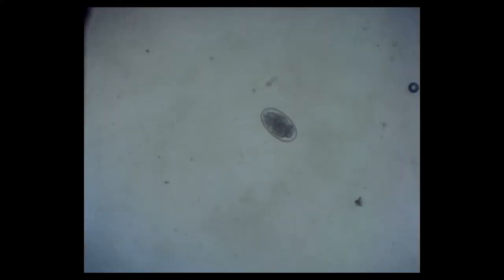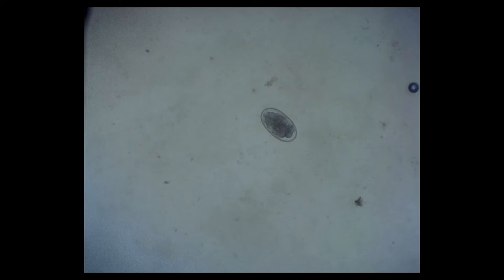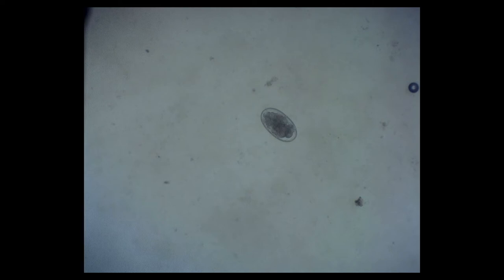What you're seeing now is a good scope cam picture of a strongyle egg. Whether this is Haemonchus, Ostertagia, or trichostrongyle — which are together known as the HOT group — is really hard to distinguish under 100 power magnification. So we just count them all the same, and that's our fecal egg count.